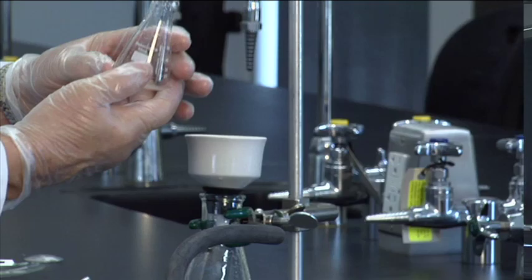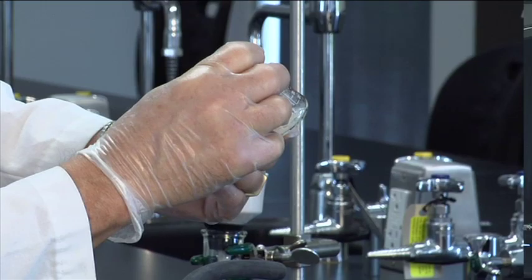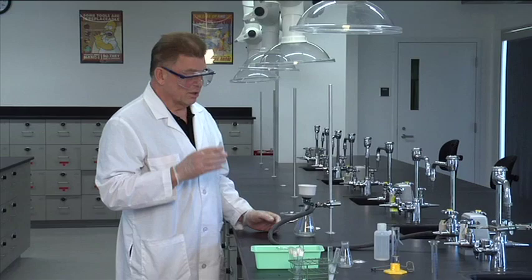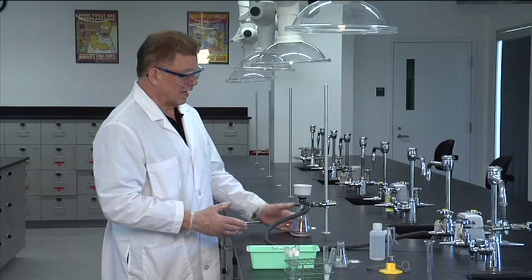It looks like there's a little bit still on the bottom. If I want to go after that, I would scrape it with the spatula and wash it out with the water again. But we've gotten the lion's share of the product. Now what you want to do is leave this vacuum turned on for about ten minutes and let the air draw over the product to dry it.